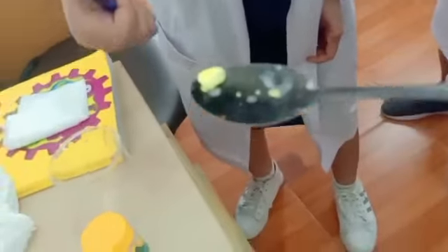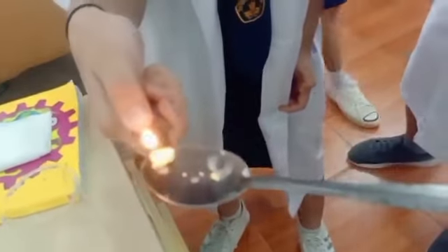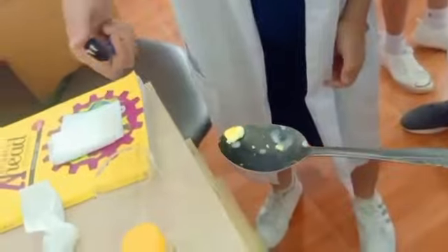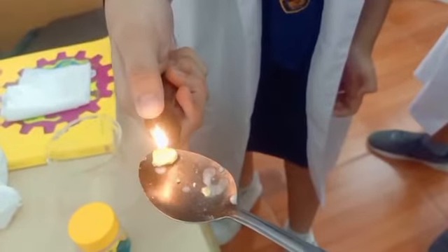Next we will try to do the experiment with the substance and water. Put the substance in the container, then pour the water. It settles at the bottom of the container, and we will feel the heat from this reaction. It's called an Exothermic reaction.